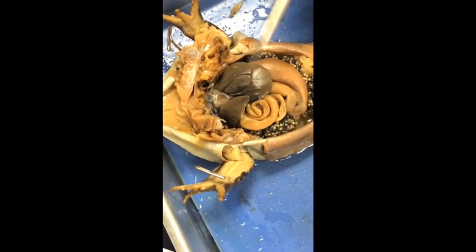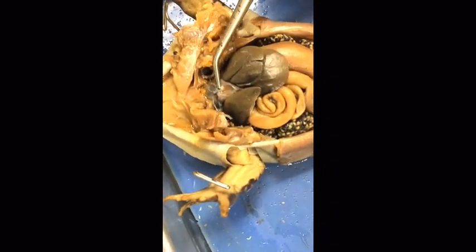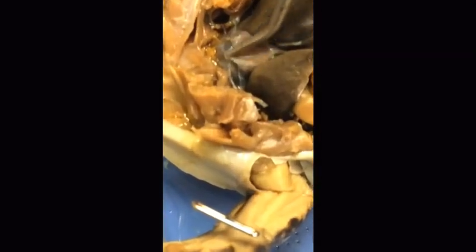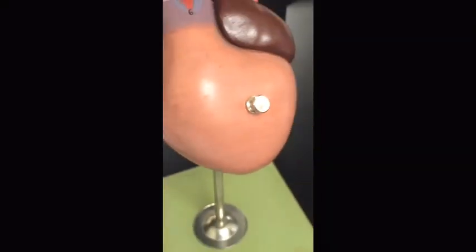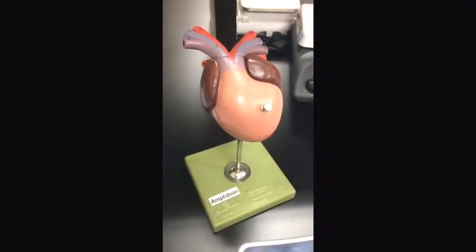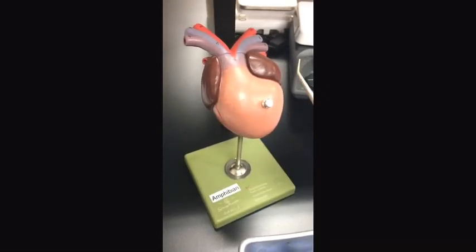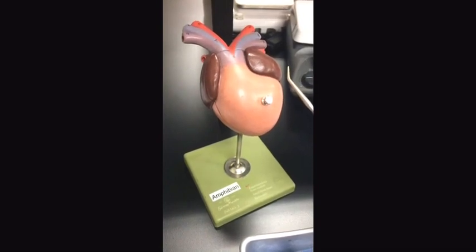Moving on to the circulatory system, the structure right here is the heart. The white membrane around it is the pericardium. The heart has three chambers: two atria and one main ventricle — the right atrium and the left atrium. The left atrium receives oxygenated blood from the lungs. The right atrium receives deoxygenated blood from the body.